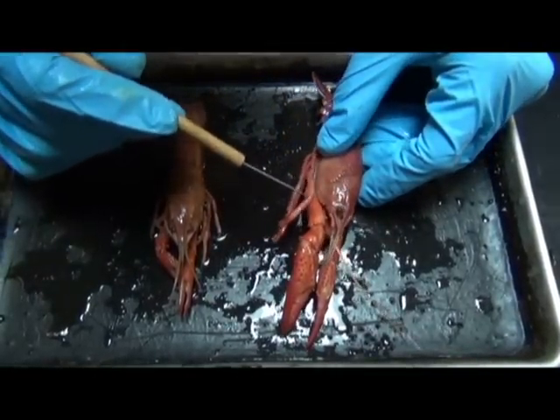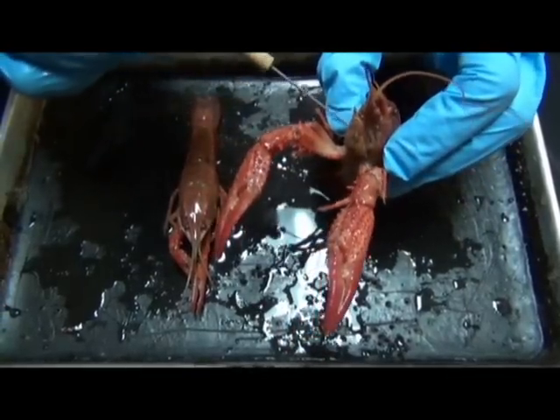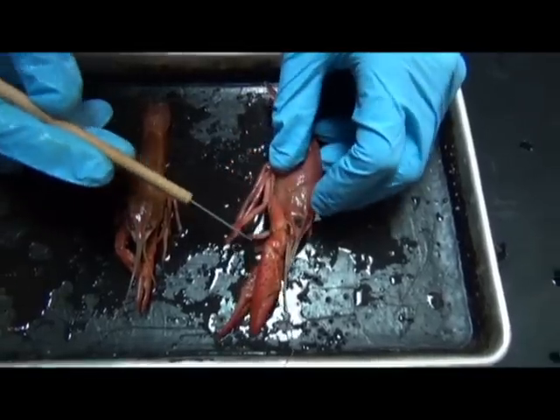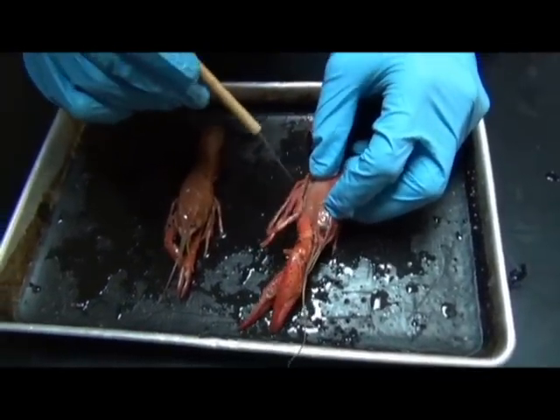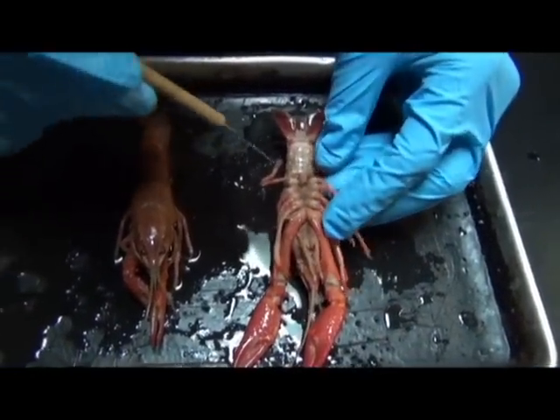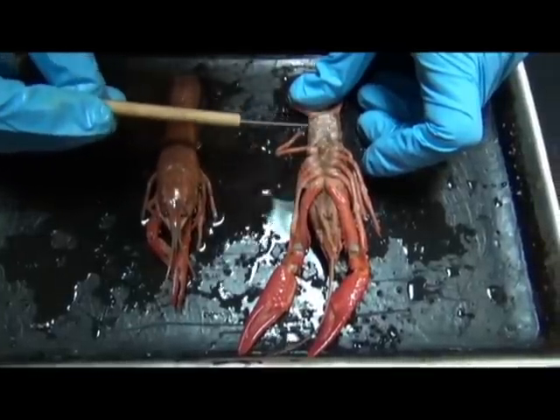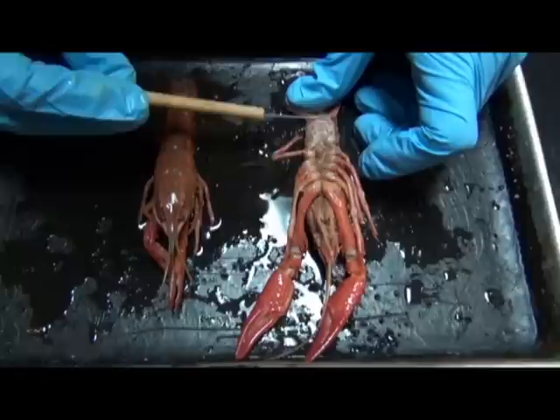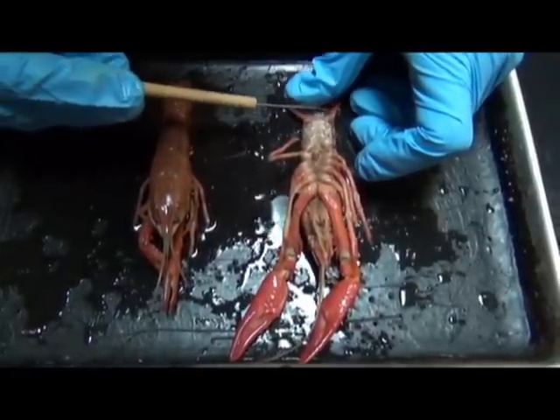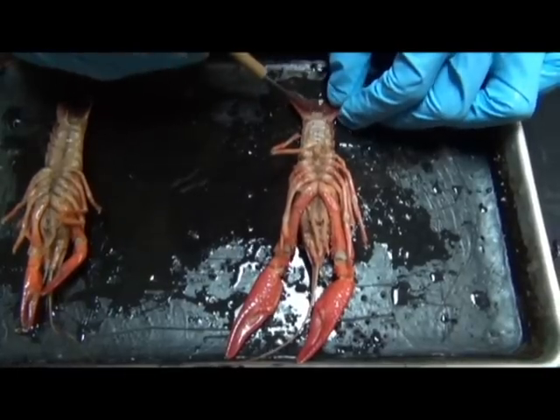If we were to turn the animal over on its side, you would see there are many mouth parts here, followed by a pair of claws, and then you have 4 pairs of walking legs, which are shown here, and this is the ventral side of the animal. And then associated with the ventral side of the abdomen are these paired little swimming legs called swimmerets. And then here's the tail again. Okay. And there is the anus of the animal.